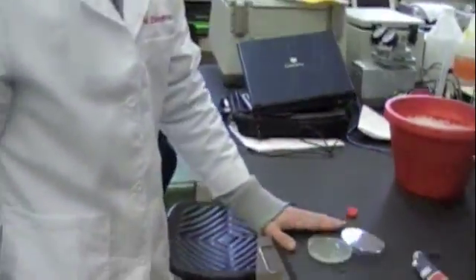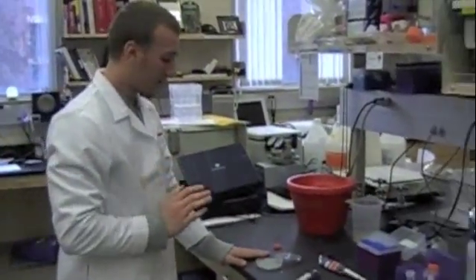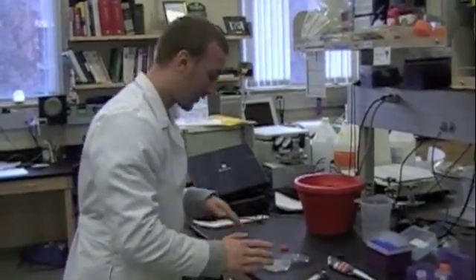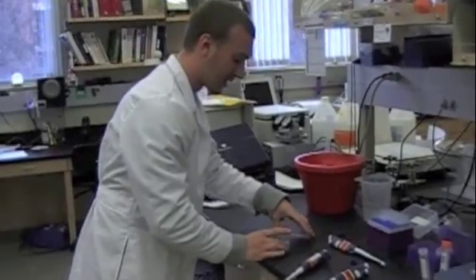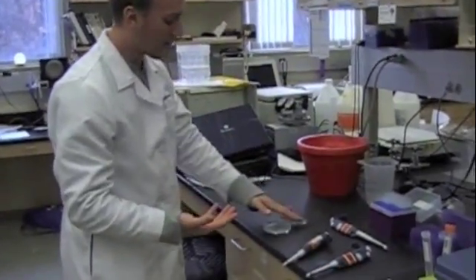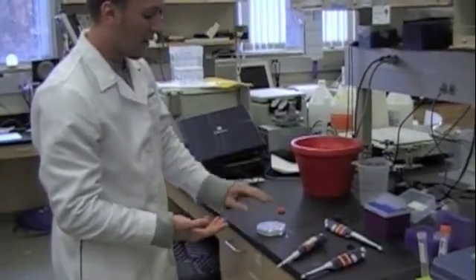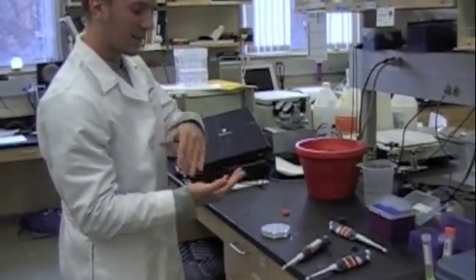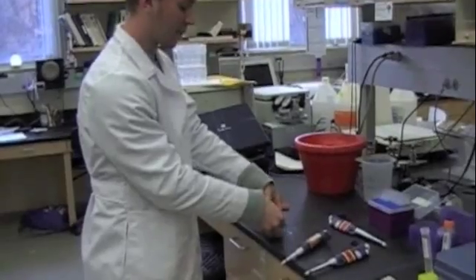Now that we've spread our cells on the agar plate, we need to let this incubate at room temperature until all the liquid contained on the top of this plate simply dries. When we put this in the incubator to incubate overnight, we want our liquid to evaporate so that it doesn't leak all over the place when we set it upside down in the incubator.